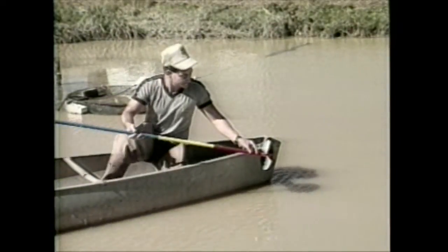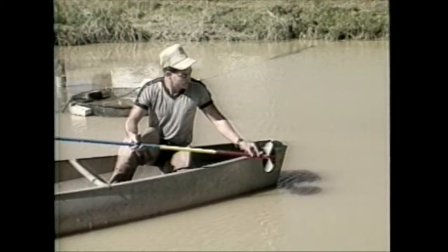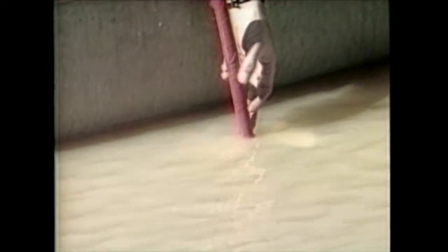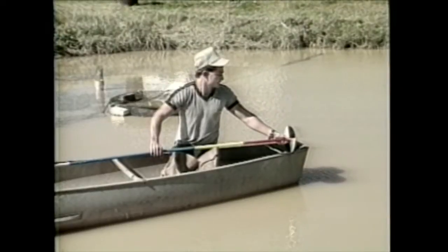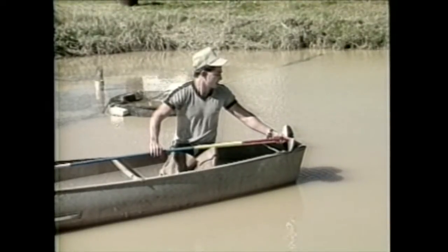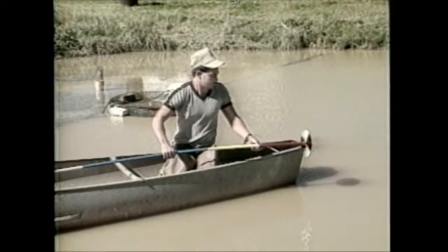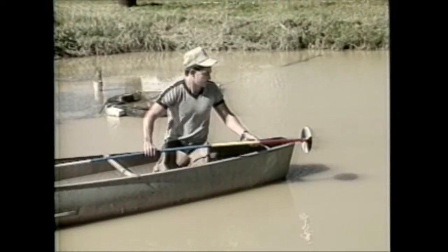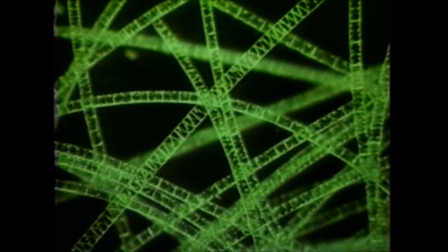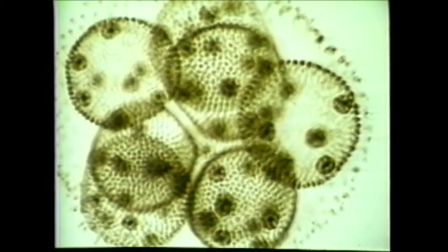There are several methods to measure the abundance of phytoplankton. Economically speaking, the practical choice for most pond owners is the use of a Secchi disk. The Secchi disk is a circular object roughly 20 centimeters in diameter, constructed of metal or plastic, which is divided by black and white quadrants. It is suspended by a rod or a rope, which is marked in gradations of inches or centimeters. A weight is usually present at the bottom of the disk to ensure its sinkage. Secchi disks may be purchased from scientific supply houses or they can be easily made. The principle behind the Secchi disk is that it correlates with the turbidity in pond water, and since turbidity in most fish ponds is due to phytoplankton, the Secchi disk is a good indicator of phytoplankton abundance.